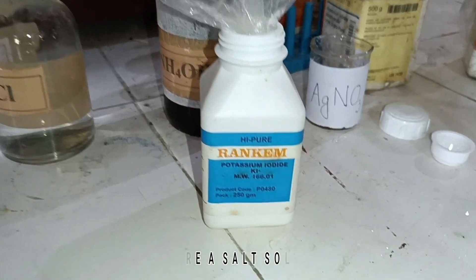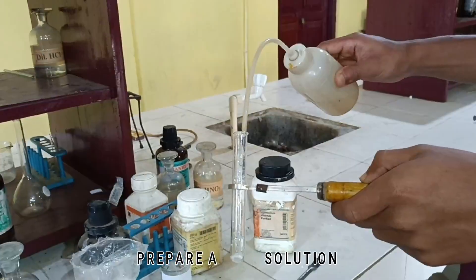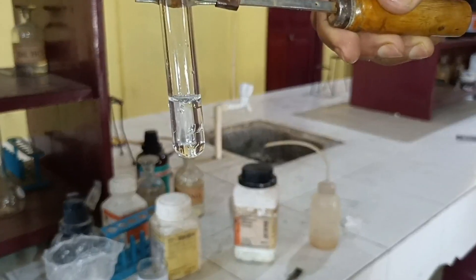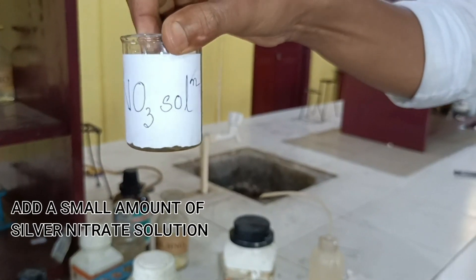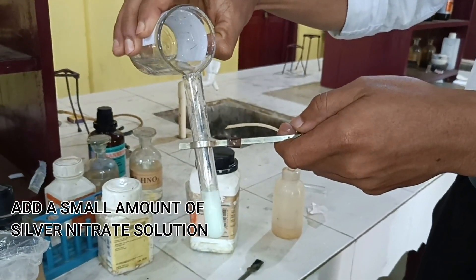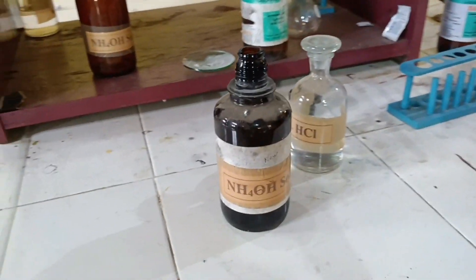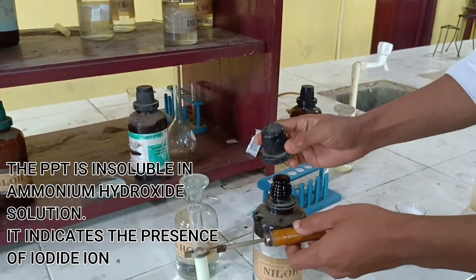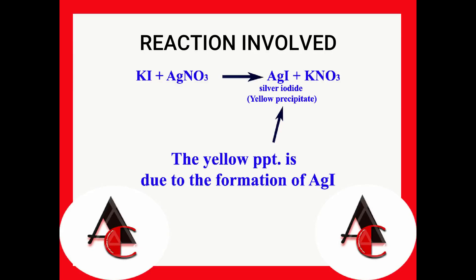For the wet test for iodide ion, again prepare a salt solution. Now add 1 to 2 ml of silver nitrate solution. If iodide ions are present, a pale yellow precipitate will form which is insoluble in ammonium hydroxide.